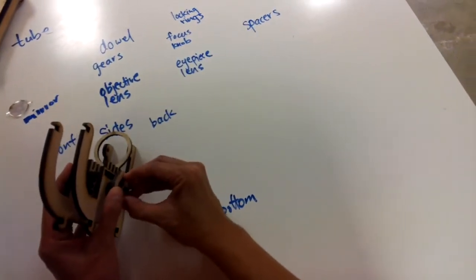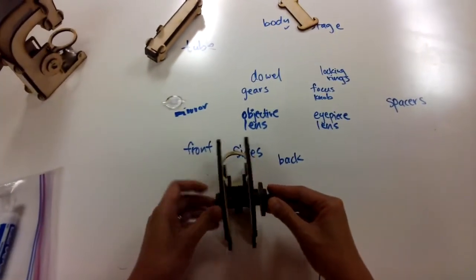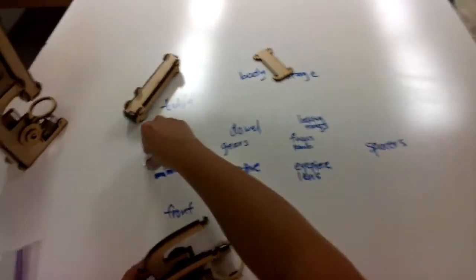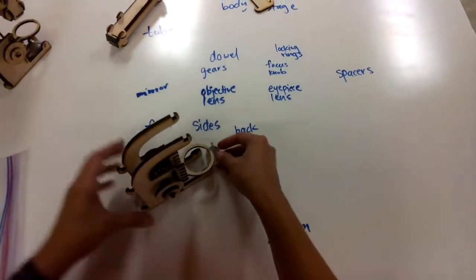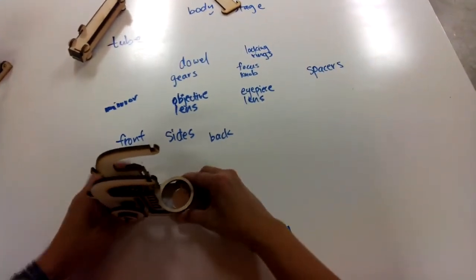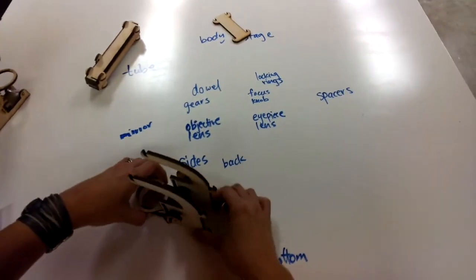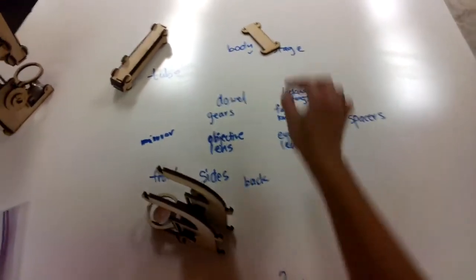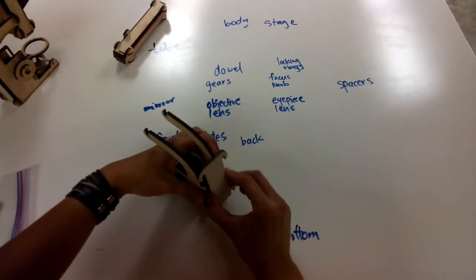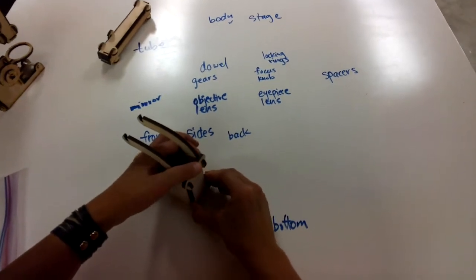And again, once you add the locking ring, you want to twist it so that it locks into place. Okay, so now this is kind of stable. So this is where the mirror comes in. The mirror is going to go on this bottom part. So you try to fit it in here into the little holes, and it should stay right there. And then finally, it's still a little wobbly, so that's where the last piece with the body comes in. So this piece will just slot right into here and stabilize everything.